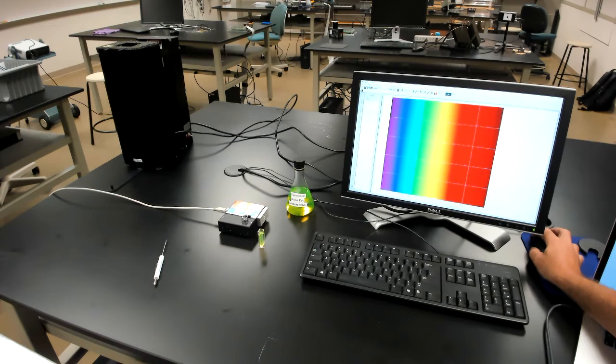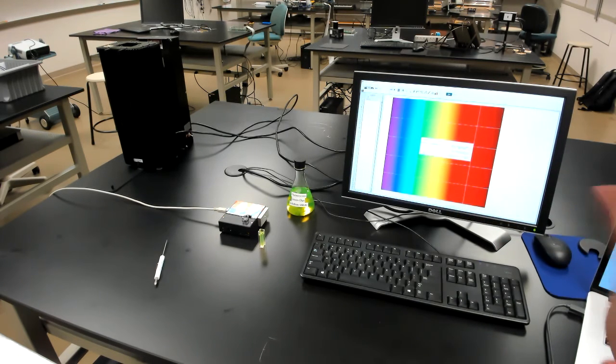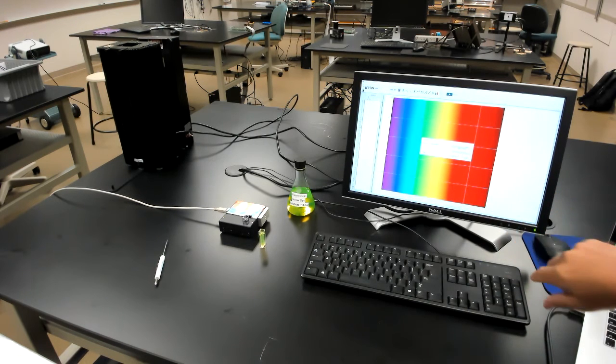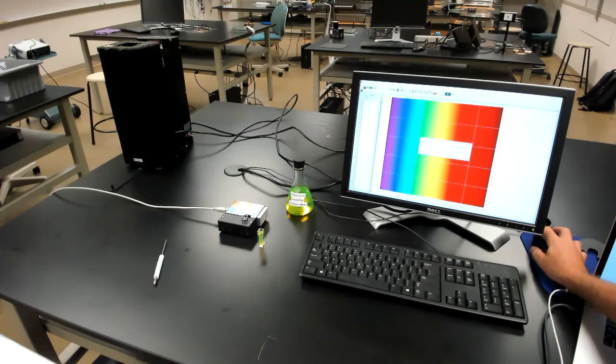Start collection. And the first thing that it does is it just brings up this box. You can't read this, but it says calibrate spectrometer. It knows it's taking a reference measurement now. And then it's also asking us to wait for 1.5 minutes while the lamp warms up and stabilizes. And that's a good thing to do, but you don't have to wait. Let's skip to the end. Okay, the warm-up is complete, and we can finish the calibration.